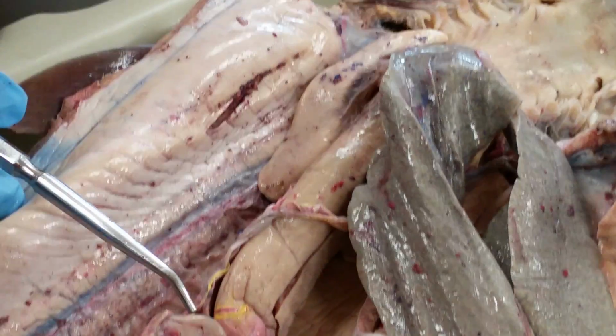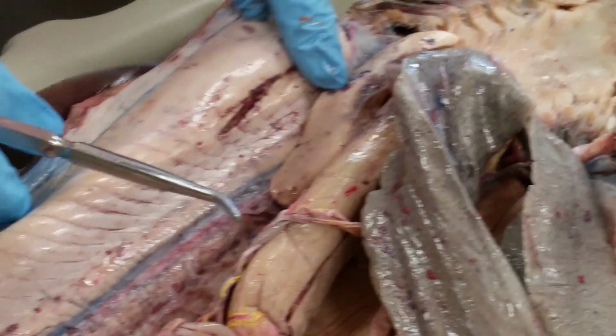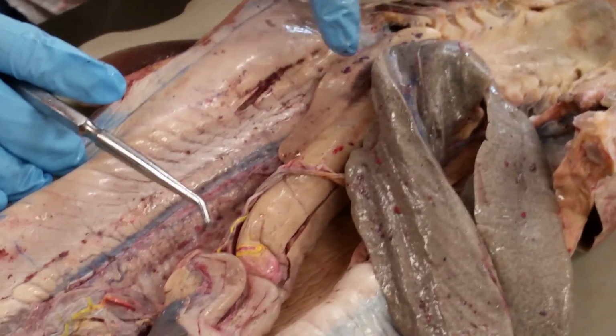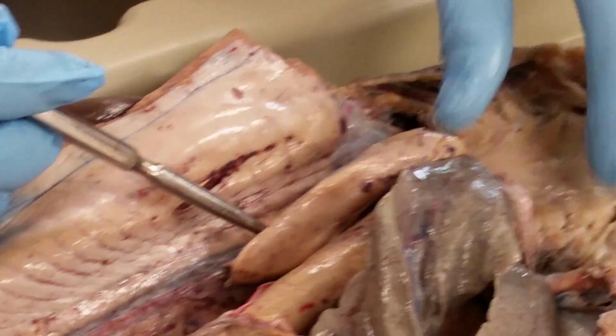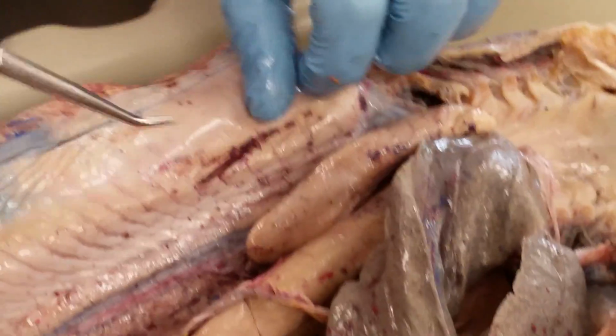you always want to check and see if there's claspers before you're asked to identify the gonads, right? So you don't want to get it wrong if you're looking at a female that doesn't have eggs in it, and thinking that it's a testes, because it could be an ovary and look the same. Alright, the mesentery that attaches the testes is called the mesorchium. In a female, that would be called the mesovarium. Okay?